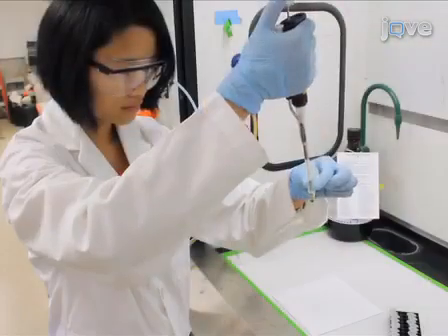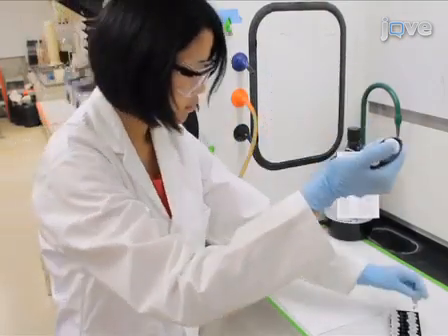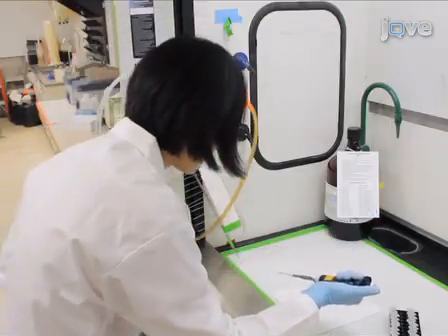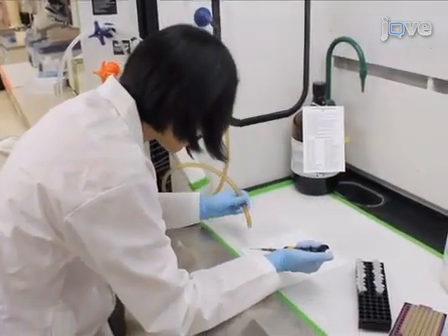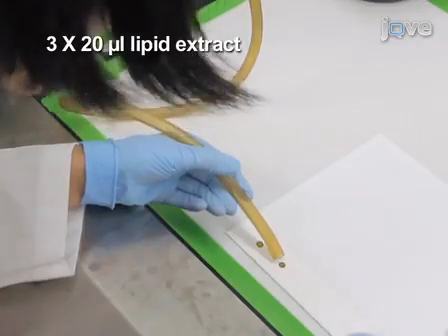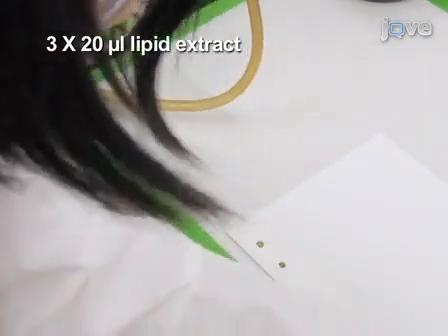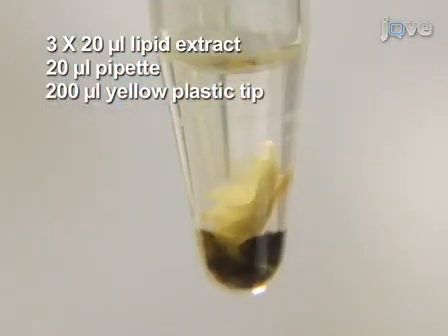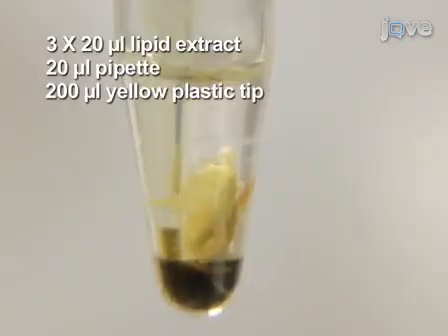In a fume hood, Tygon tubing connected to the regulator of the nitrogen tank is used to provide a stream of nitrogen gas. Slowly deliver 3 × 20 microliters of the lipid extract from the lower chloroform phase to the plate using a 20 microliter pipette with a 200 microliter yellow plastic tip under a slow stream of nitrogen gas.